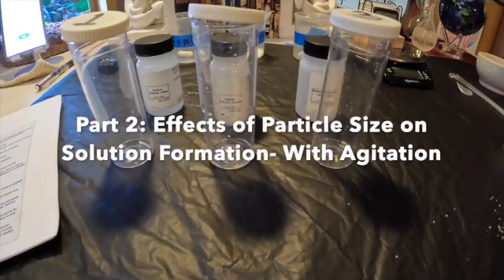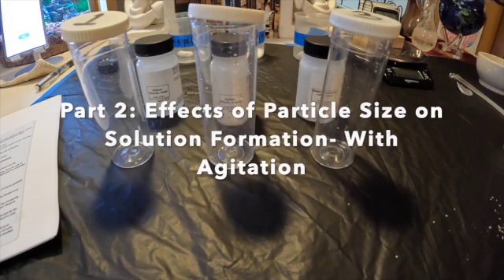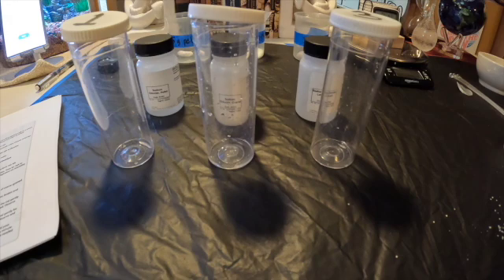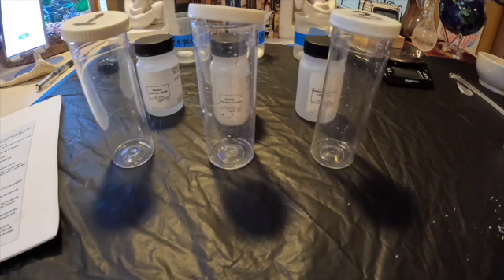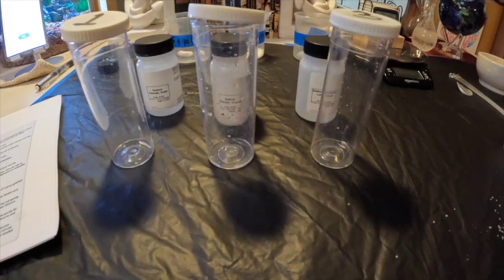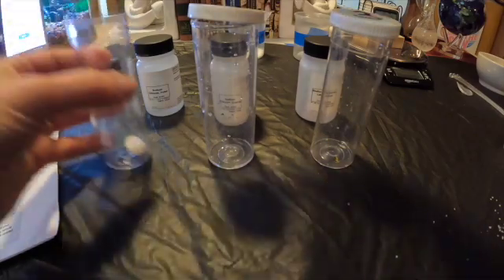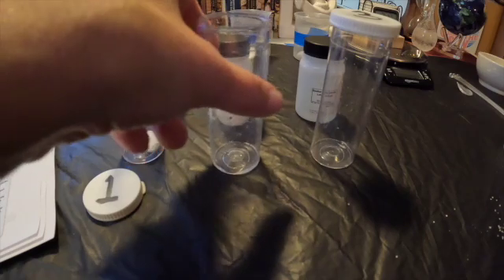For part two, we are going to look at the effect of particle size on solution formation with agitation — meaning we are going to shake the vial. I've pre-measured out five grams of each again: five grams of the pellet salt, five grams of the coarse grain, and five grams of the fine grain. We're also going to add 20 milliliters of water. I'm going to start by adding the salt to each that I've pre-measured out.